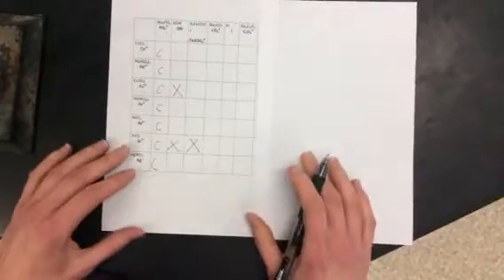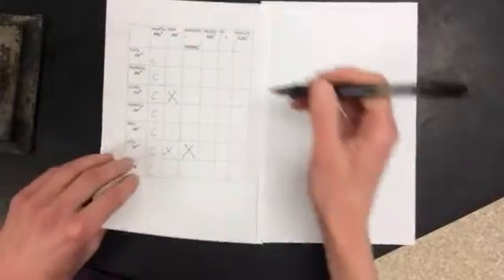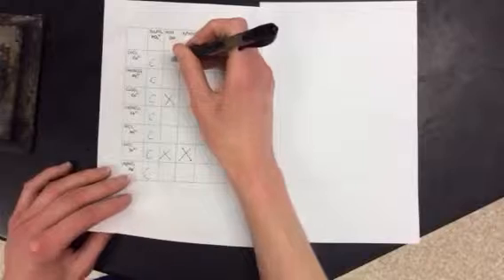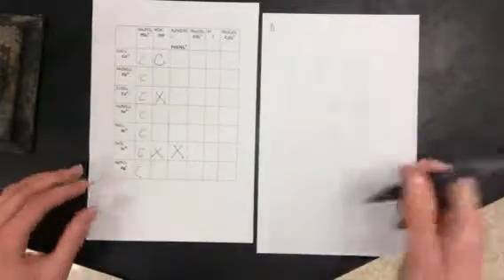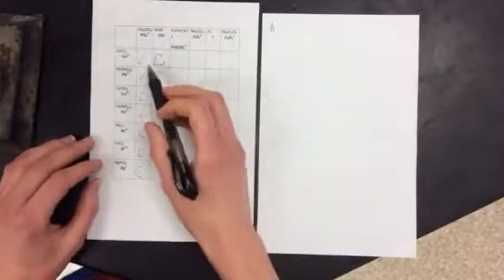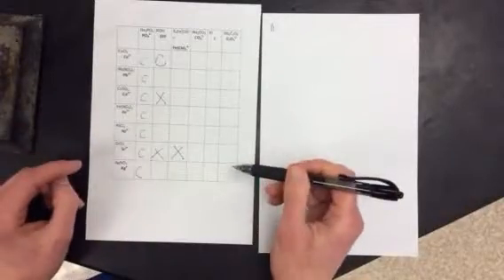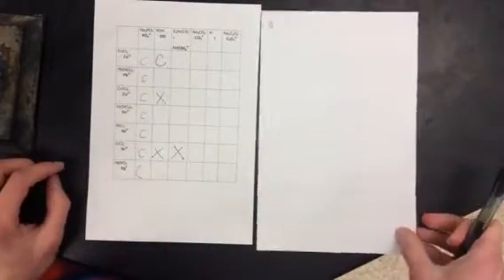You need to write 12 names and formulas of these different compounds that formed. So maybe just number your paper from 1 to 12. You can decide how best to do this. Now I haven't filled this out obviously, but yours should be all filled out. So you just need to pick 12 squares that have a C where a reaction actually happened and write the name and the formula for those 12 squares.